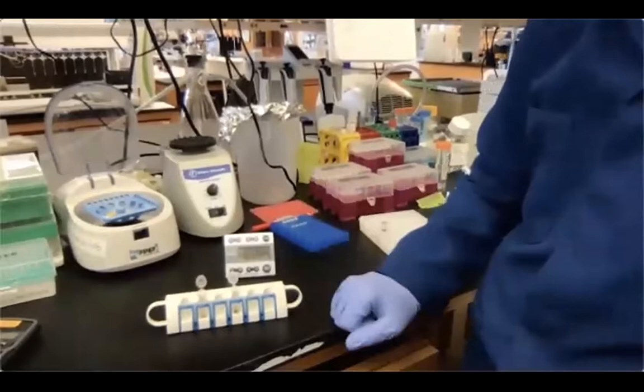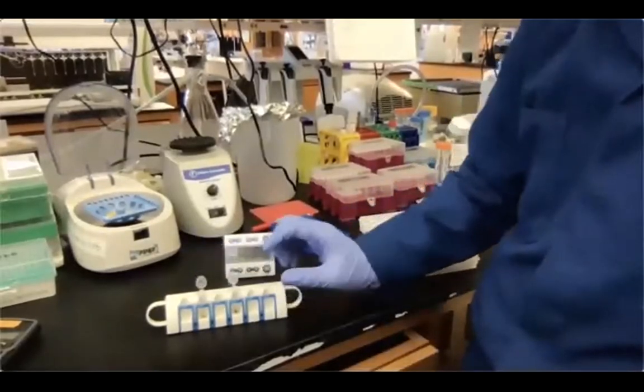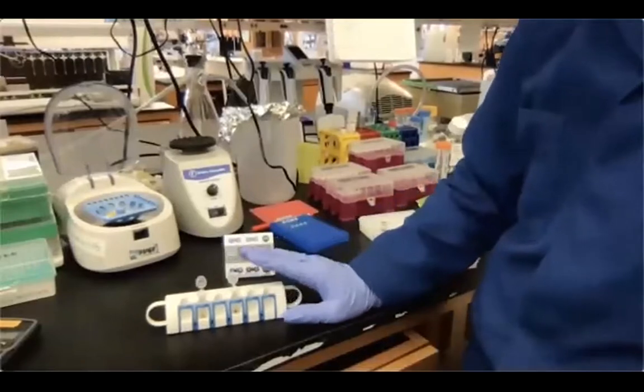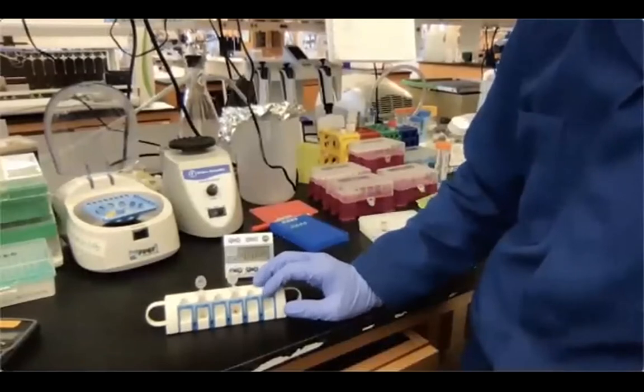supernatant removal. So it's really important now to know the volume of the supernatant you have to remove. I usually prefer to leave 5 to 10 microliters of the supernatant in my tube, so as not to dislodge the bead pellet. I'm not discarding the beads, which as of now are attached to the library DNA.